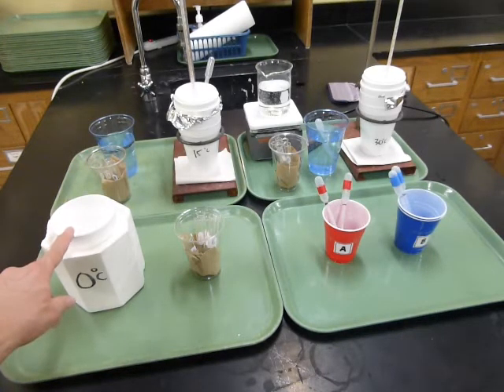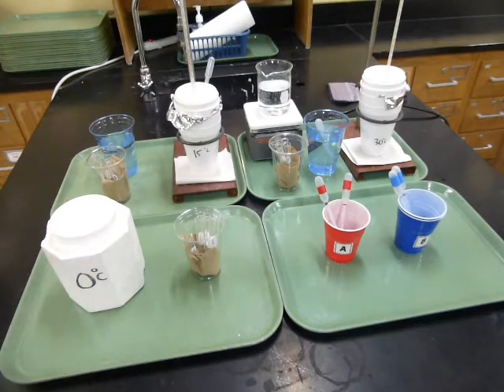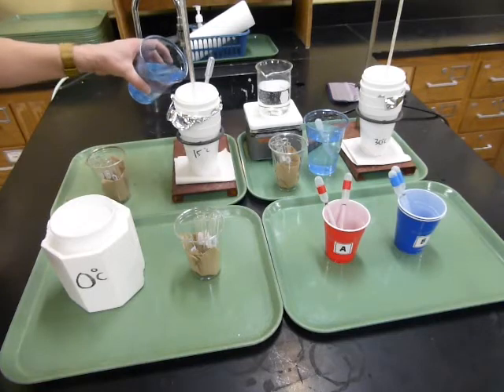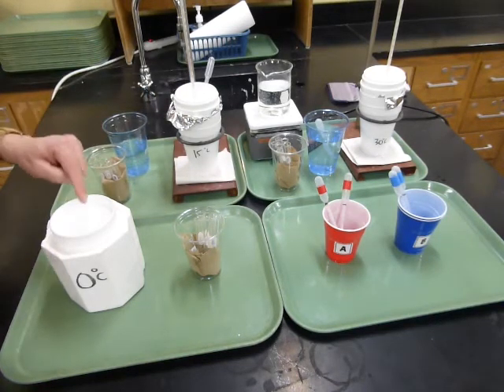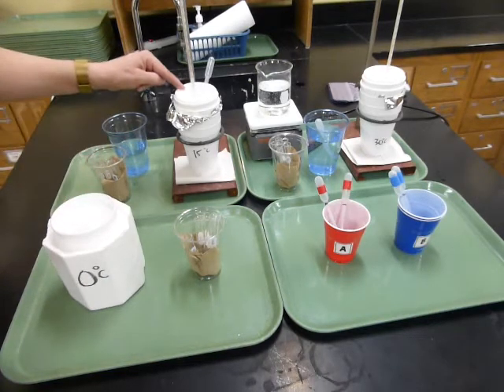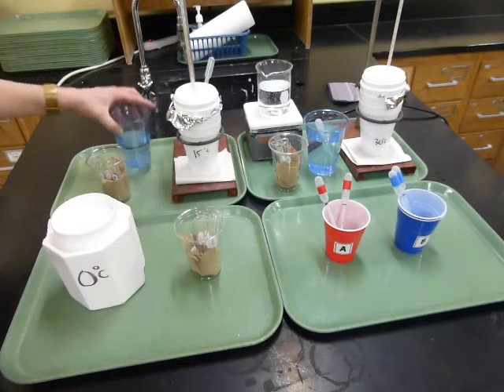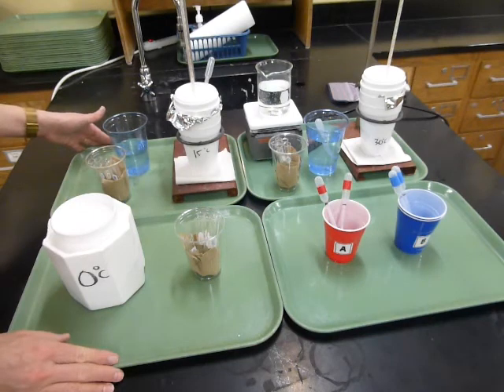Now, the 0 degree one is easy. It's just going to be ice water. That's by definition 0 degrees Celsius. So we don't have to control the temperature of that one. The 15 degree one, though, is a little bit cooler than room temperature. There's a cup of room temperature water that you can use, put a little bit of that in, and then you can take some of the water from the ice bath and put it in here and look at the thermometer and make sure that the thermometer says 15 degrees. If you need to warm it up or cool it down, use the water that you need accordingly. These 2 trays will be next to each other so that you can do that.